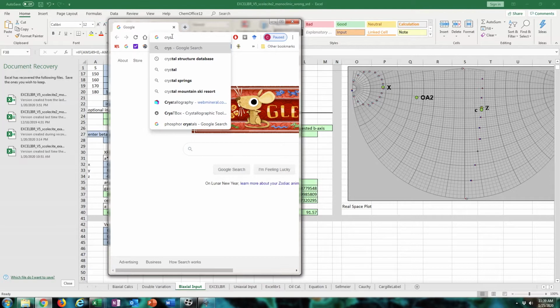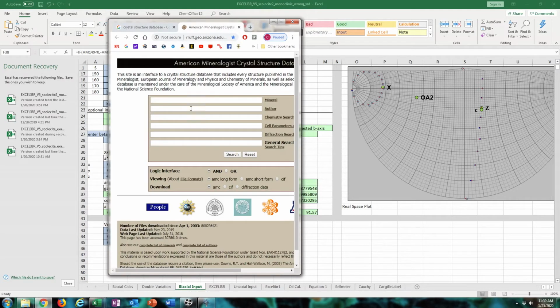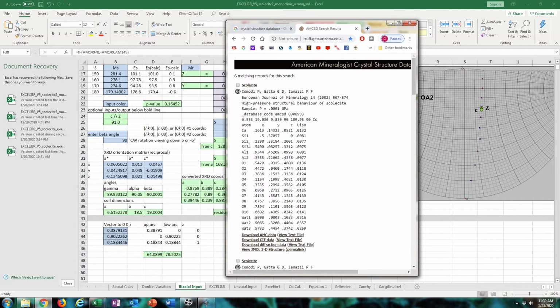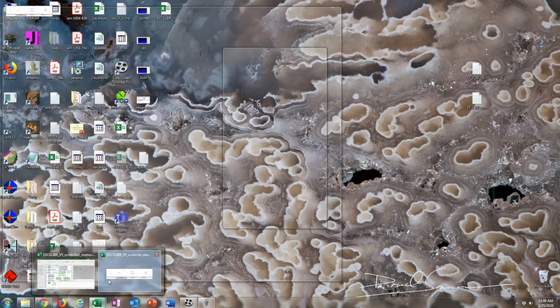What you can do is go to the American Mineralogist Crystal Structure database, enter in a mineral, and see if someone has published in that particular lattice. So this one is solved in CC for those lattice parameters. There are old settings listed below this publication in the F1D1 lattice, which corresponds to that orthorhombic face-centered lattice, but of course it's actually monoclinic and it's non-standard.